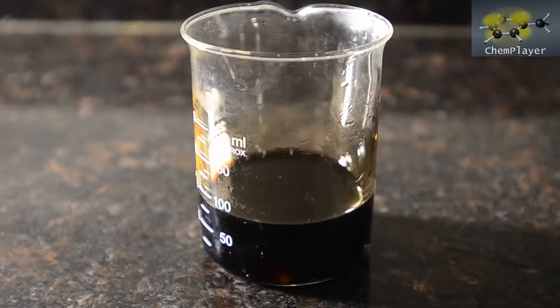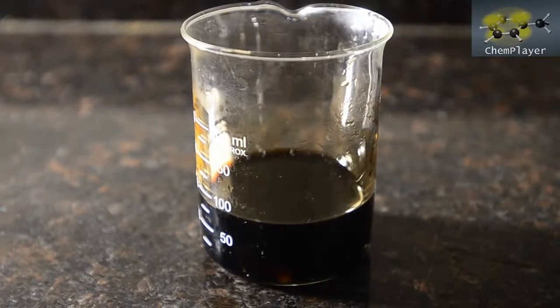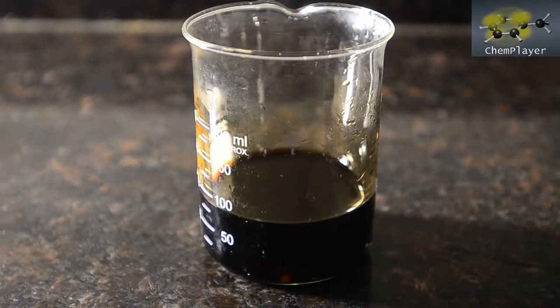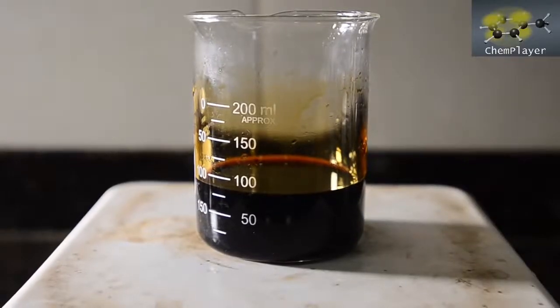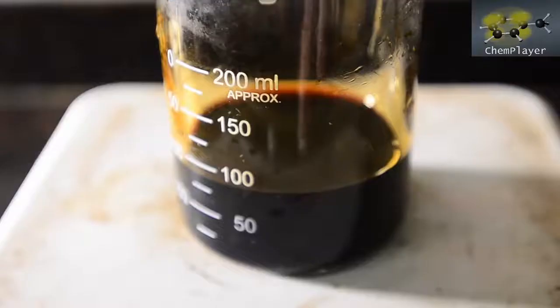Well, in order to get our hydrolysis product out, we're now going to need to neutralize the excess sodium hydroxide and convert the sodium phenolate salt back into the free phenol again. So let's get our filtrate onto a stirrer and get it stirring well.